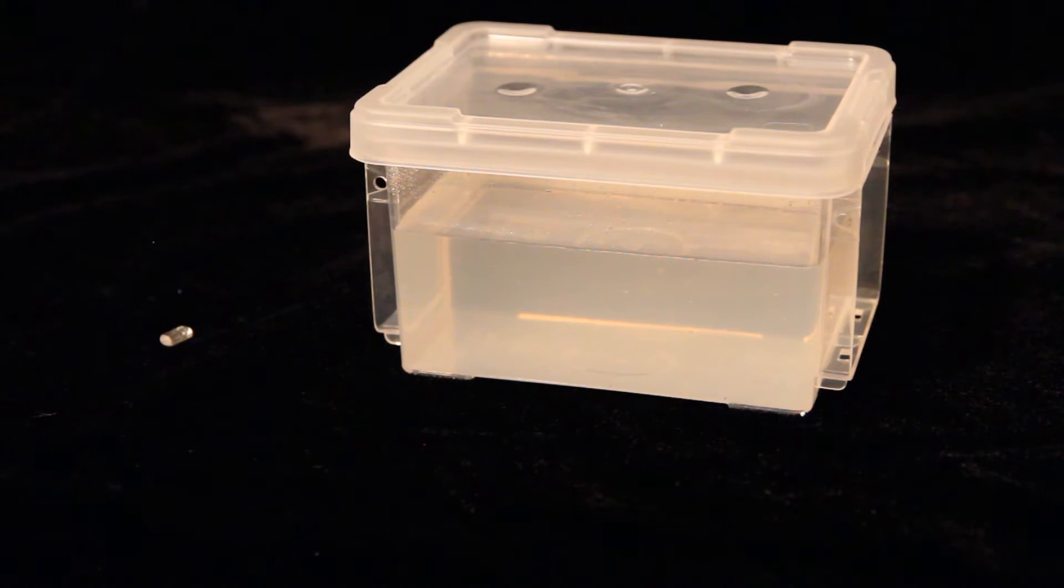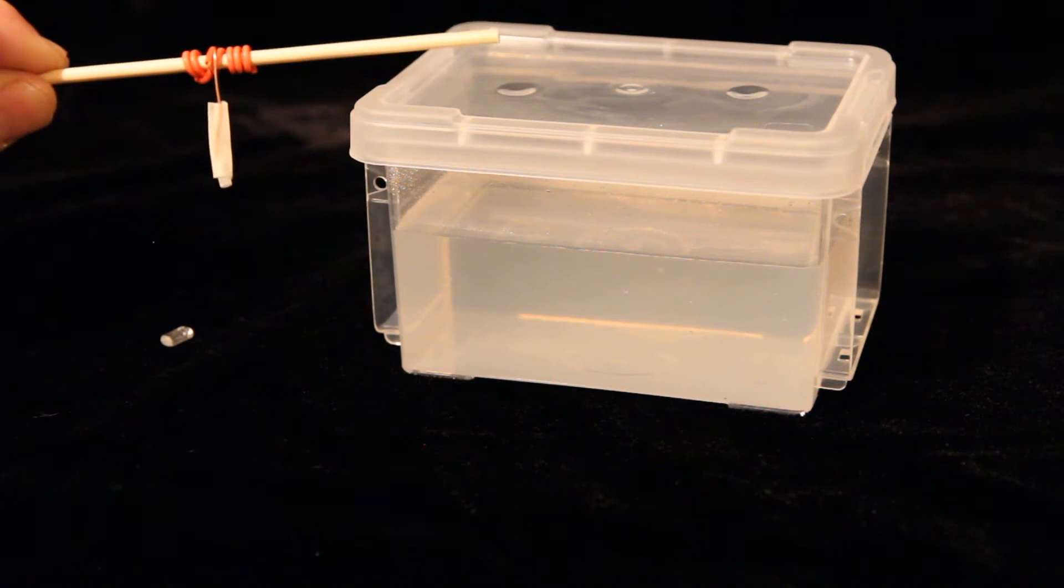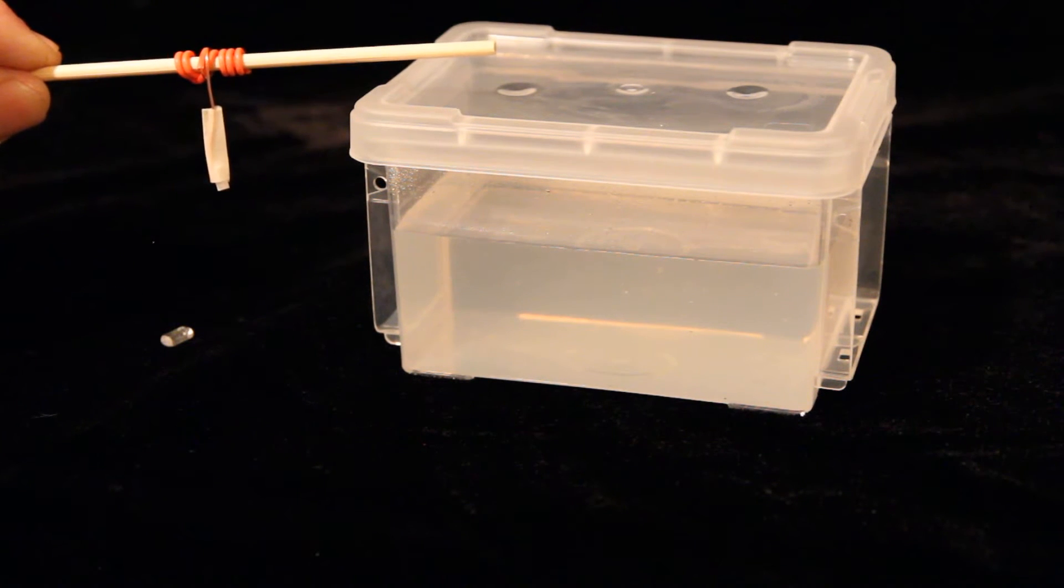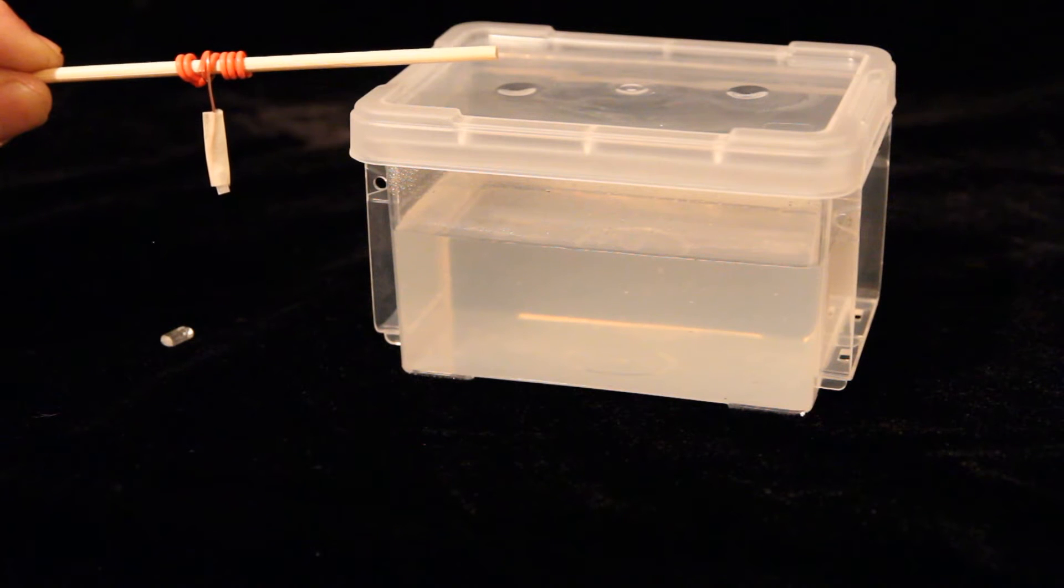I like taking one of them and mounting them on the bottom of a wire that I can suspend in the solution. This way I get a cleaner crystal growth.